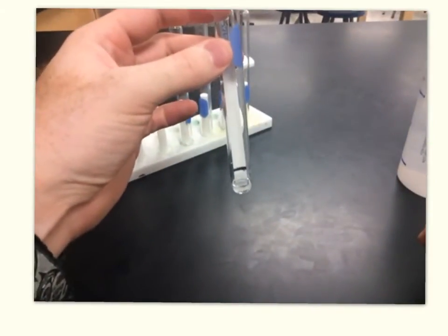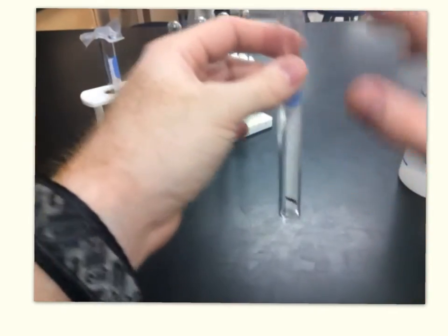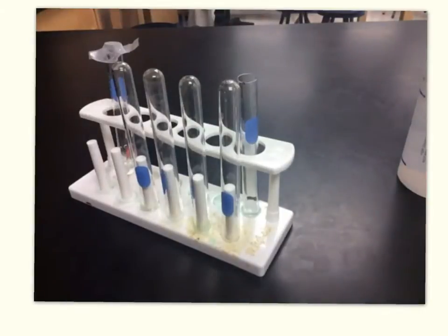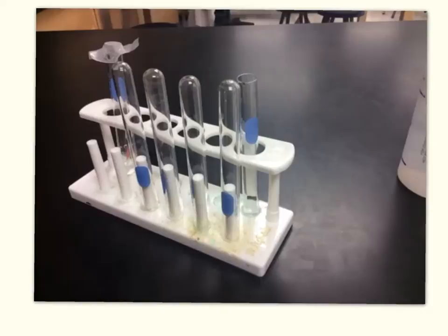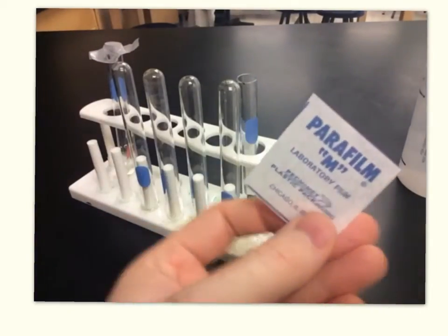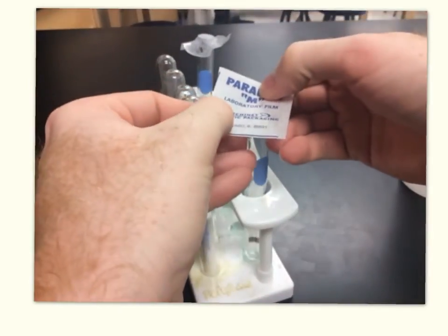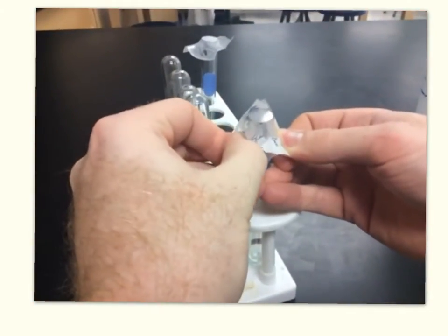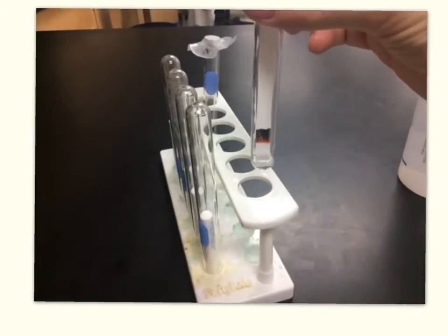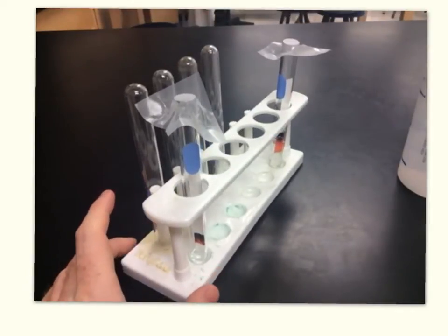You can see that the water is going to start moving up the paper. In order to keep the water vapor concentration the same throughout this test tube, we need to put a cap on it using something called parafilm. Parafilm is basically a piece of paraffin wax. There's a papery side and a waxy side — you want the papery side up so the waxy side touches your test tube. Grab the two corners, put it over the test tube, and pull straight down until the paper breaks. It'll stretch to cover the test tube and you've got an airtight and watertight seal. You can already see the mixture starting to separate. It's really important you don't move the stuff around too much while it's separating.